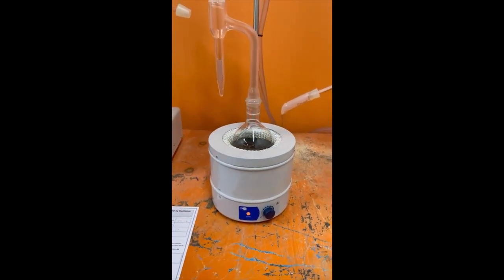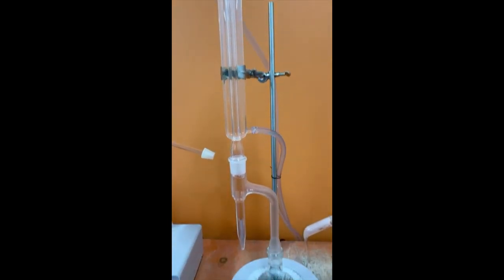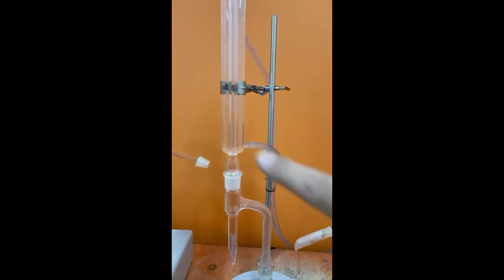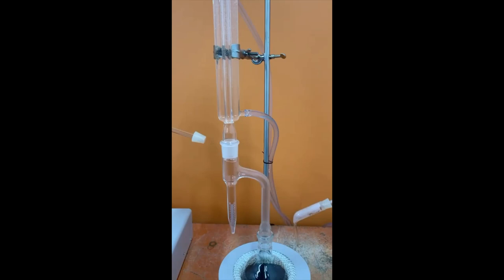So as we said, this is the test with the apparatus. Now the distillation water circulation is here. It is clear. Now it is in the circulation.